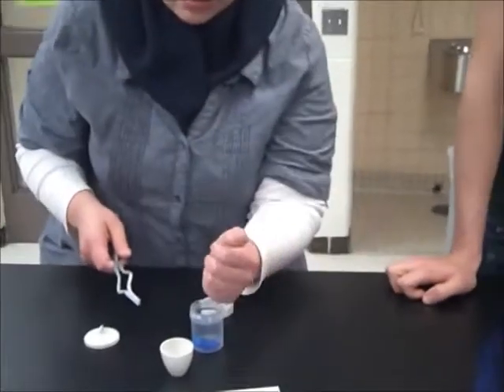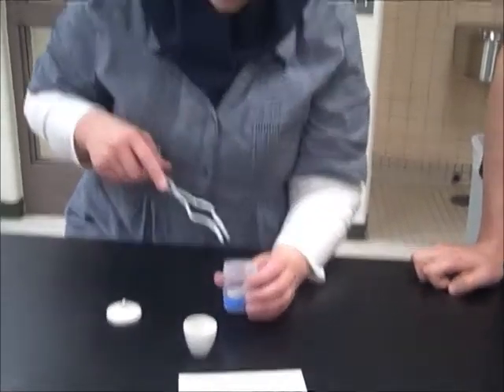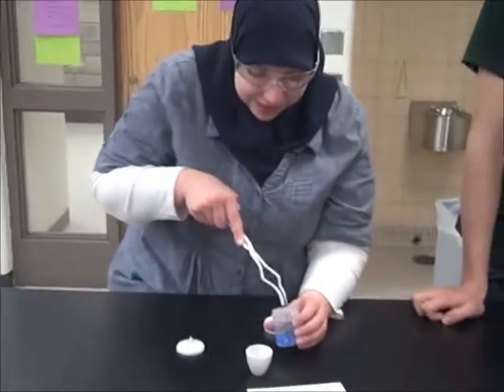Very nice looking. So what we're going to do, it's actually not very exciting at all, unfortunately. I'm not supposed to say that. Make sure you edit that part out. No, we'll leave it in.